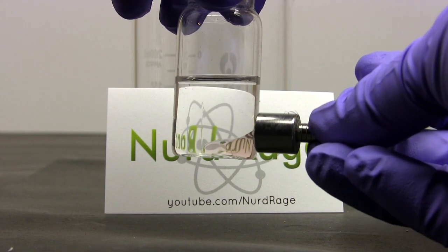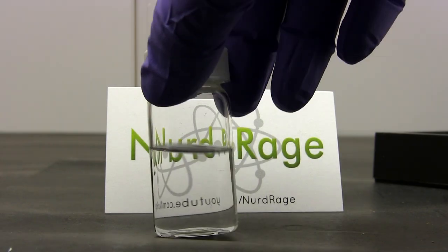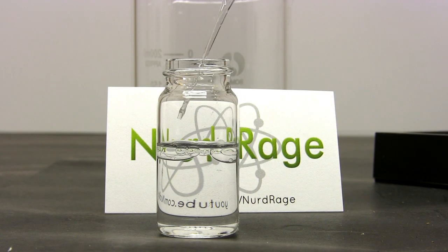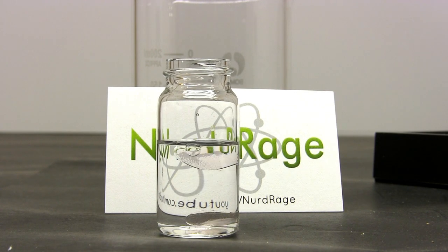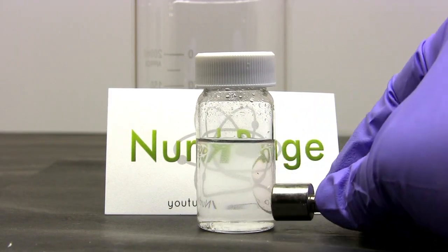We need to match the density by diluting the manganese nitrate. To find the right density we start with some dichloromethane, about 15 milliliters, and add a milliliter of water which floats. Then we add manganese nitrate solution incrementally until the whole drop can easily be pulled around with a magnet. You'll need to do some trial and error to find the right amount.